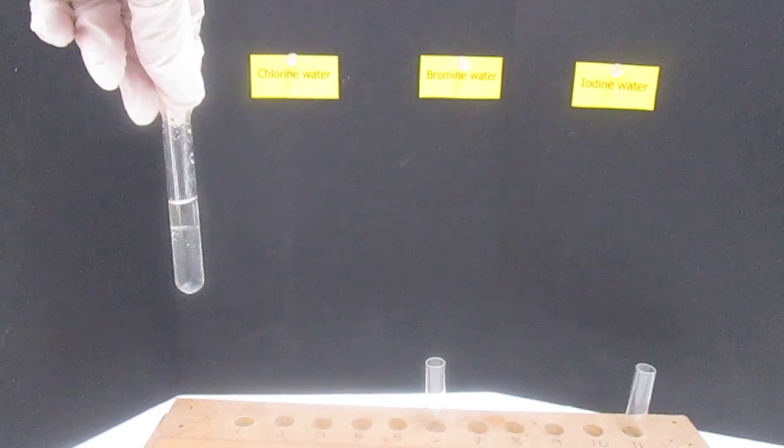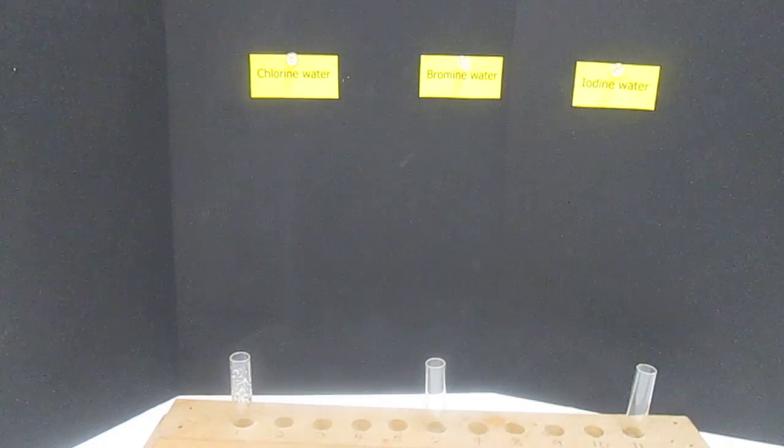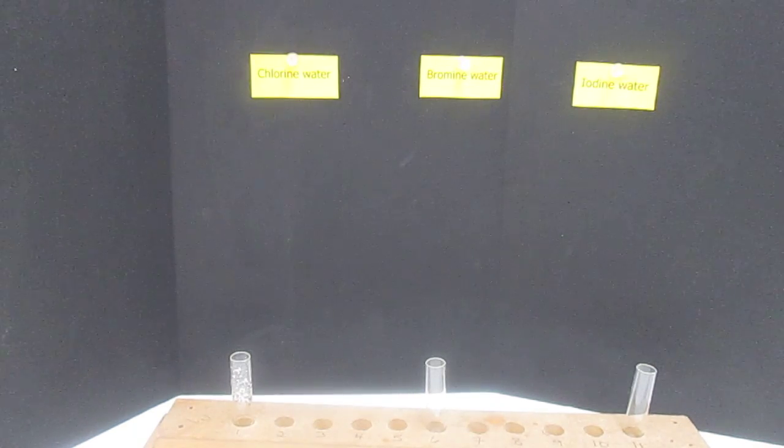I'm afraid our chlorine water has probably seen its better days. It smells of chlorine, but does not really appear to be kicking out the actual chlorine that we needed. So, water layer and hexane layer both look fairly clear. Possible tinge of yellow to it, but not very much.